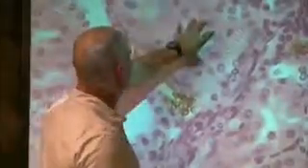I would ask stuff like here, where you can definitely see that it's a tube. I'm not going to ask for a bunch of cells kind of smushed together. On the test, you're going to see a tube, okay? A tube like this or a tube like this, okay? If it's got stuff in the middle of it, it's proximal. If it doesn't, it's distal.